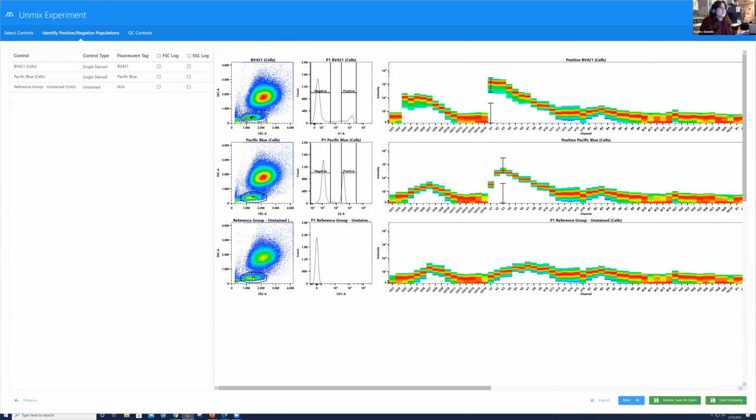Now again, I'm focusing on this population because all I'm looking to analyze today is the lymphocytes. Okay? I am ignoring this negative gate because I reference the unstained control as the negative here. So I'm not going to focus on this negative right here. And all I'm going to focus on is making sure that my positive gate is in the right position, okay? We make sure it's around the brightest part of the positive. If I were to set this positive gate here, I would have errors in my data. It would not look good when we looked at the data, okay? I need to make sure that our positive is around the brightest part. Again, single color controls need to be as bright or brighter than the experimental sample. So we're following that rule, okay?